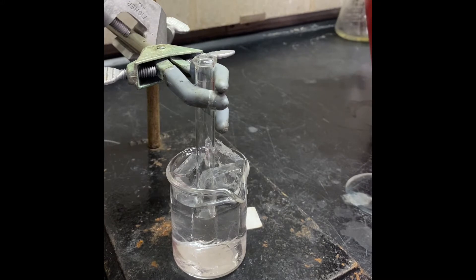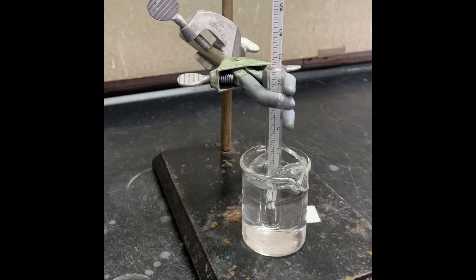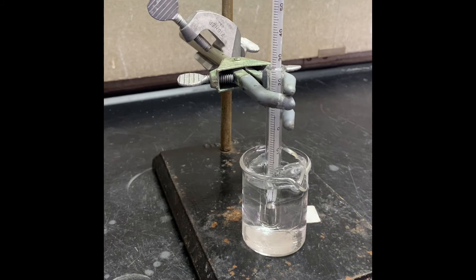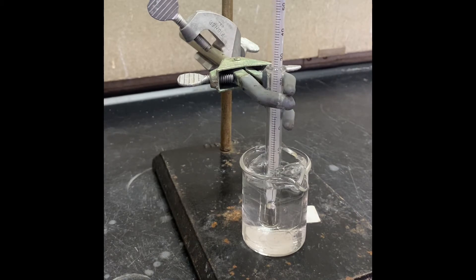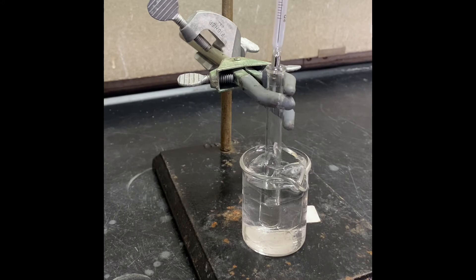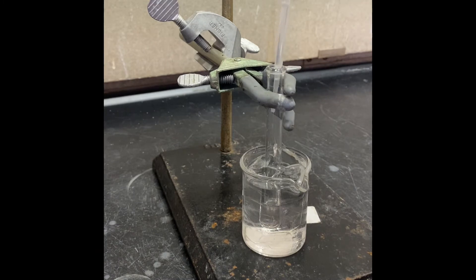So we're going to let it cool down and then when it's ready we will add our catalyst sulfuric acid which is going to be 0.4 milliliter. We're going to add that drop by drop. Now I'm going to wait to get cool enough. It's been 10 minutes and the temperature right now as you're seeing around 5 degrees Celsius.